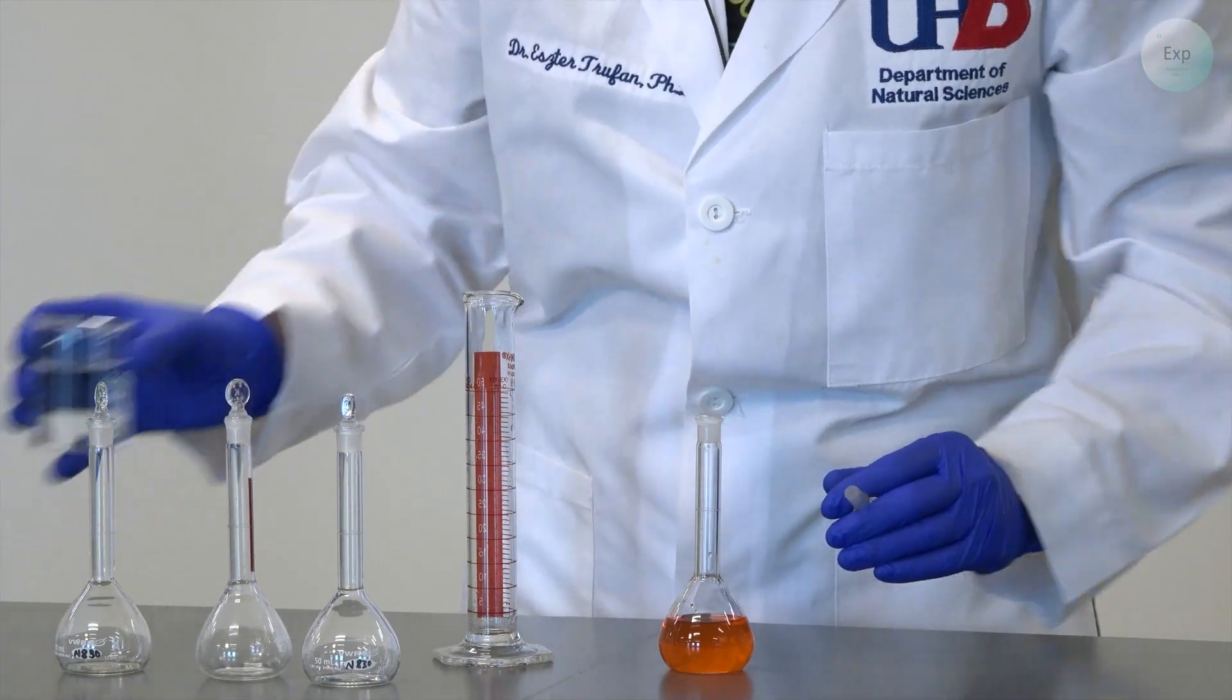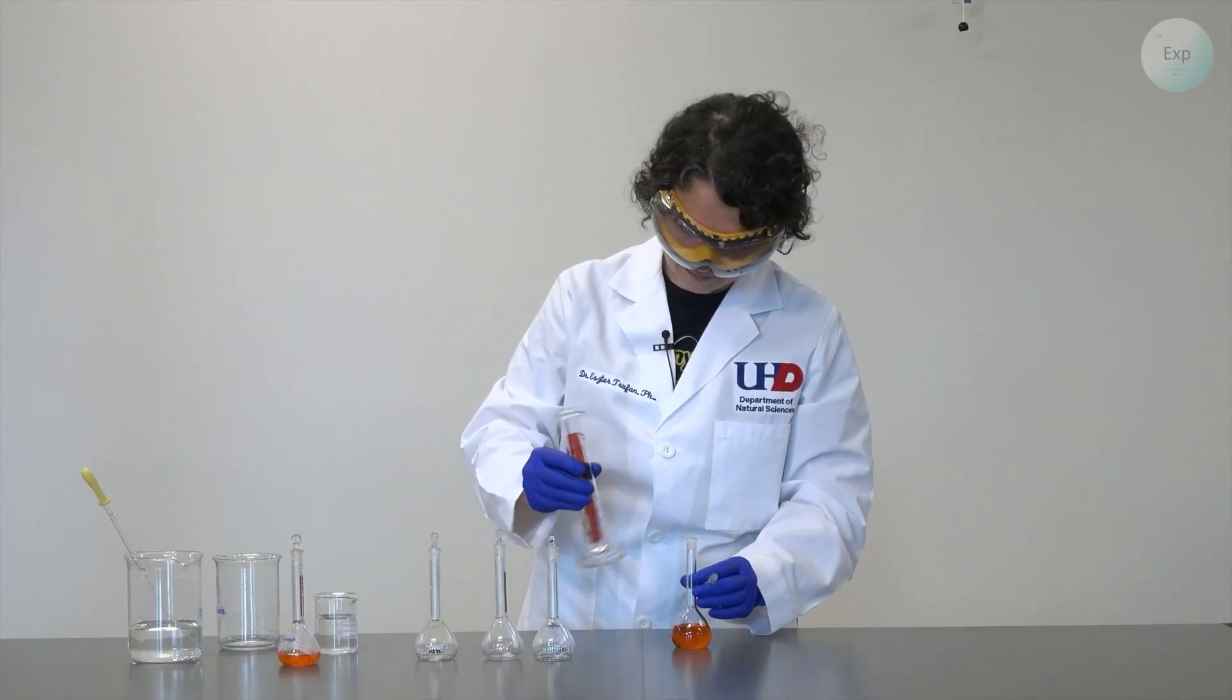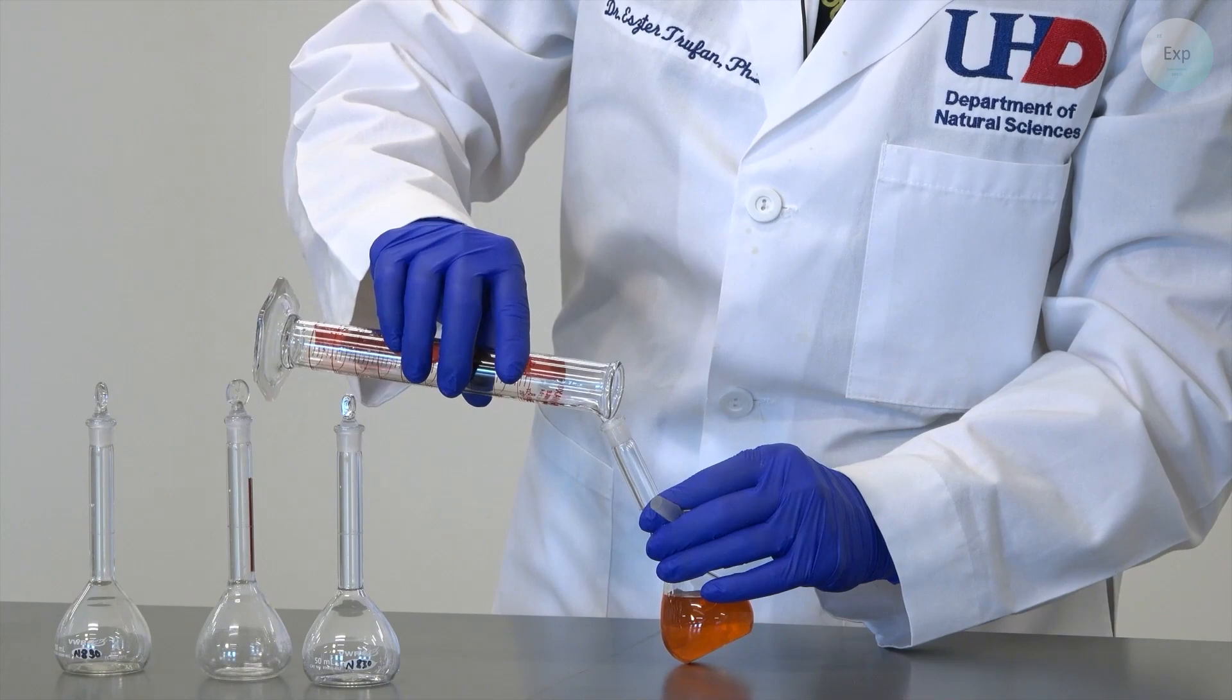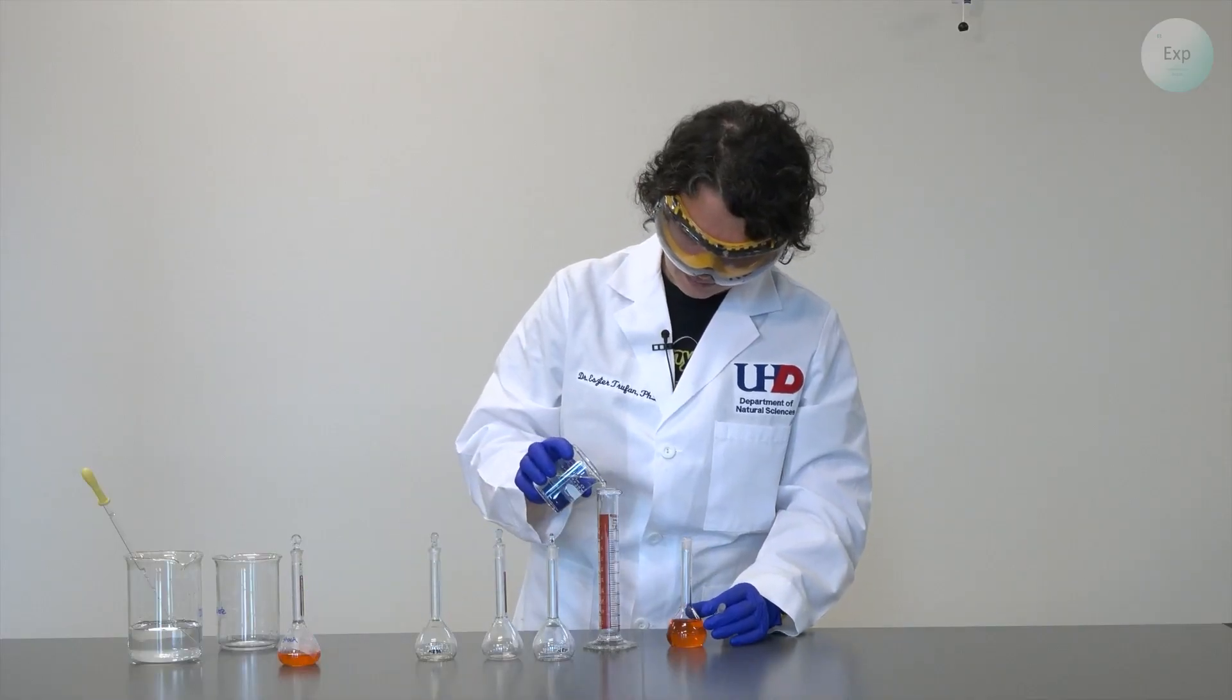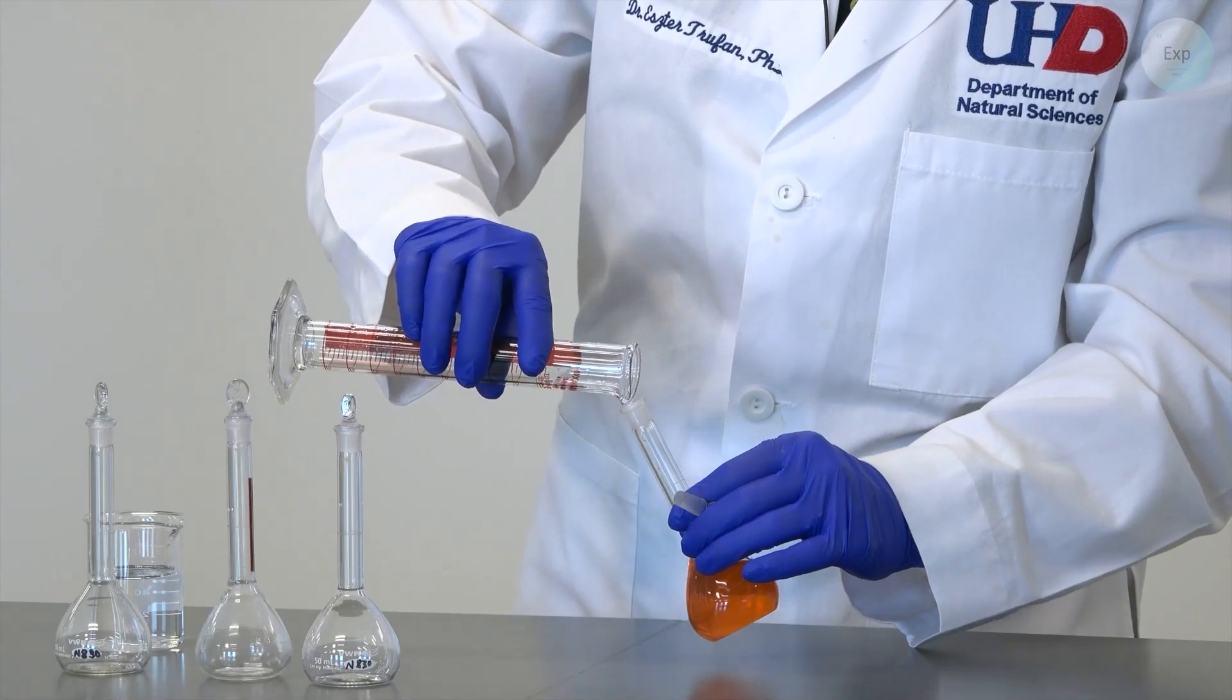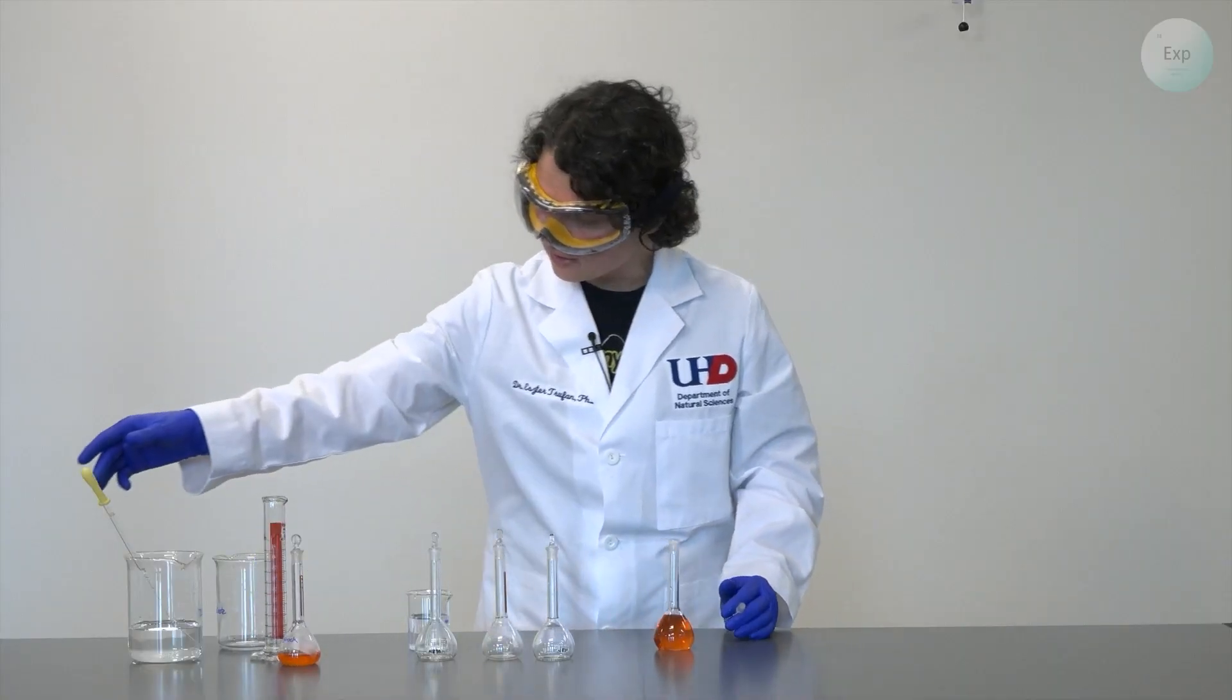And now we add a small amount of water into the graduated cylinder, rinse it really well, and transfer it over. We do it one more time. And then we set our graduated cylinder to the side.